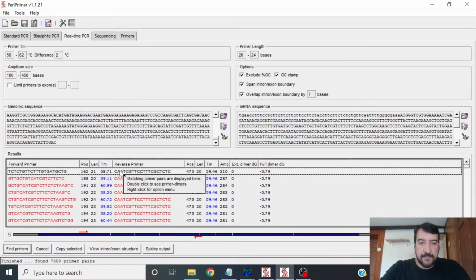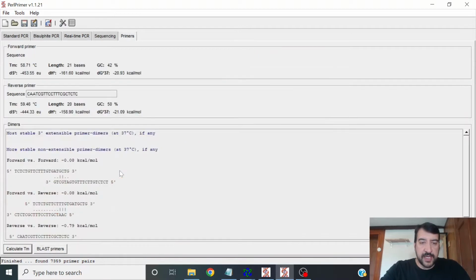If we click this, our first one on the list, you'll see further characteristics like its Tm and everything that you could see on the previous page. But you'll also see the possible extensible dimers. Extensible dimers are where the 3' end of the primer binds to another, either itself or the other primer, and therefore can elongate. And non-extensible dimers are the opposite.